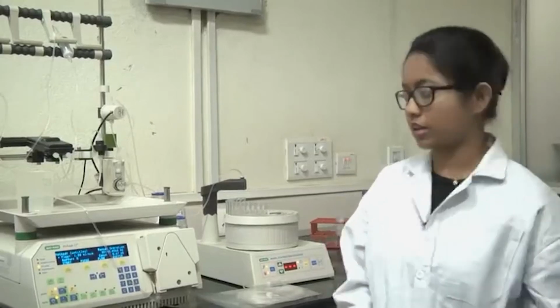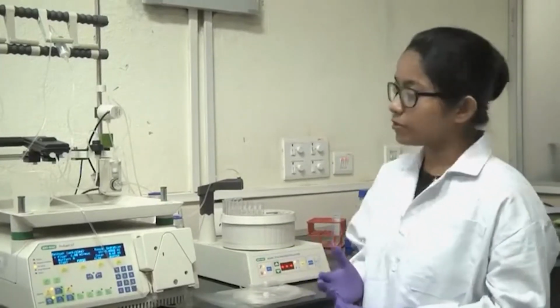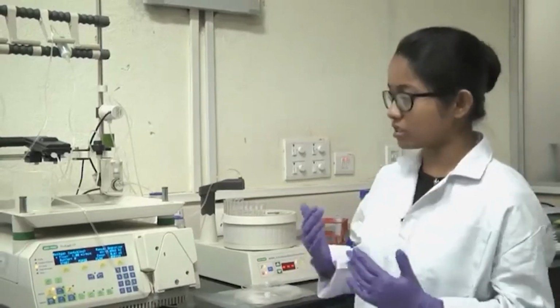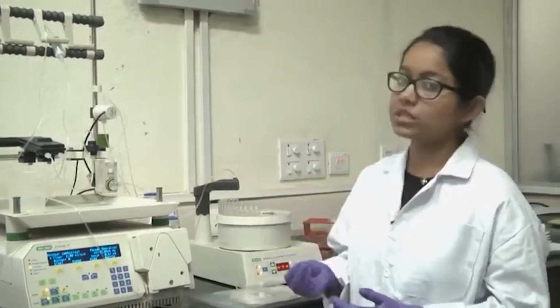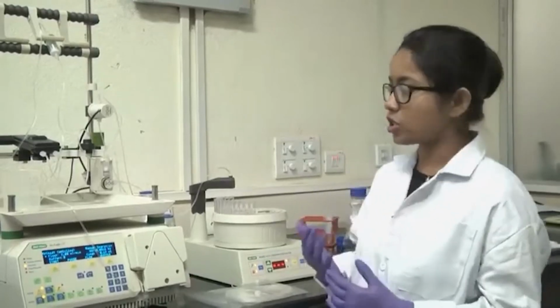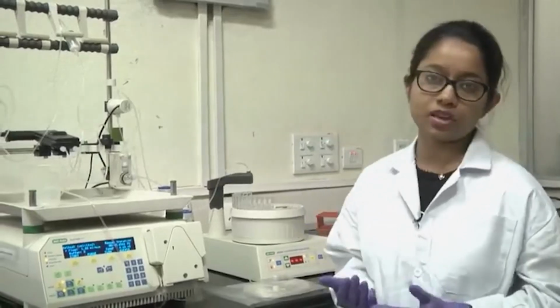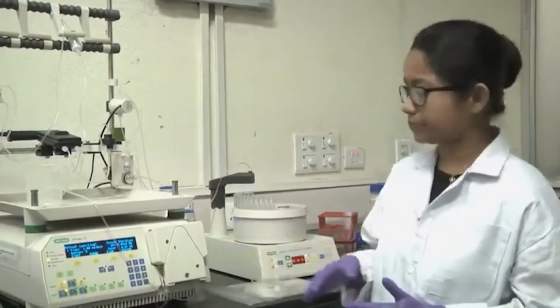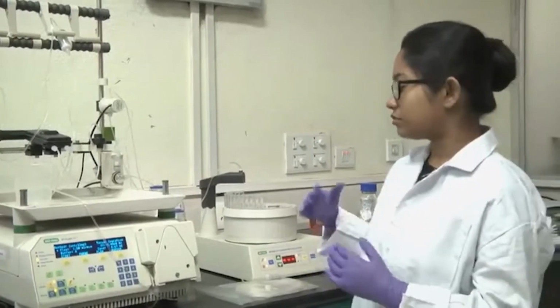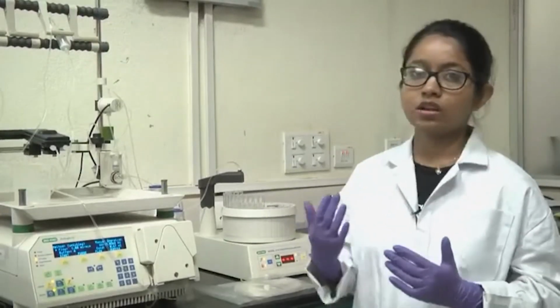Now I am going to talk about some practical aspects of an FPLC run so that you can run it properly. Remember one thing: before you start a run, all the tubes and your column are kept in 20% alcohol, which stops any kind of bacterial or fungal growth and increases the lifespan of your column and also of the machine. Because the column is in 20% alcohol, you start your run with water.